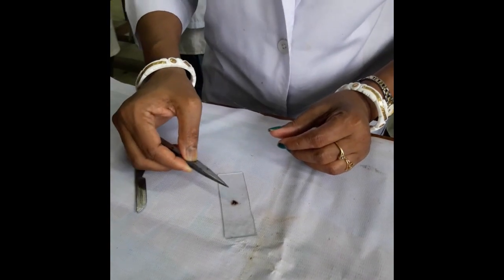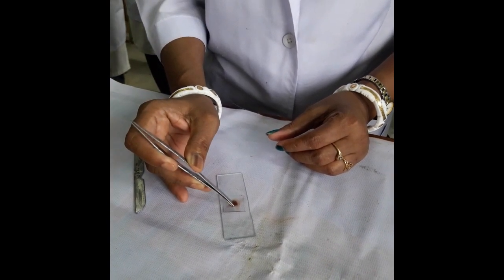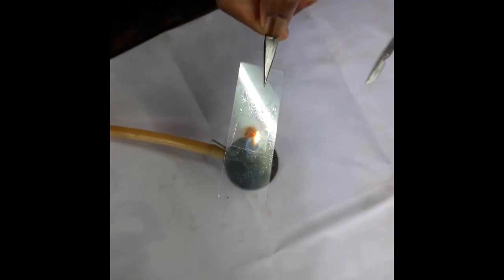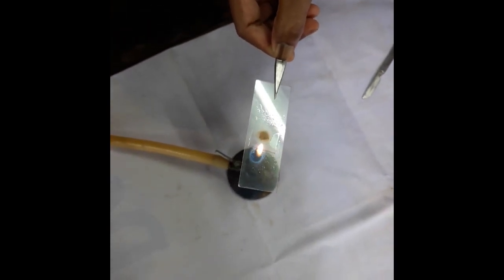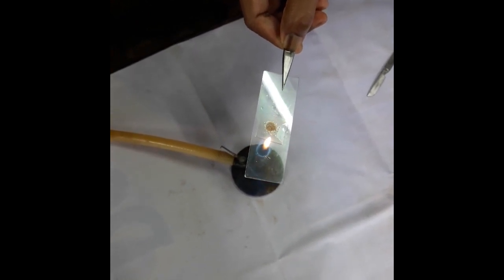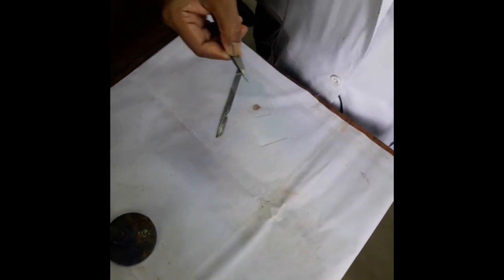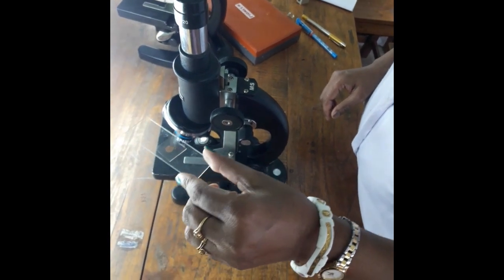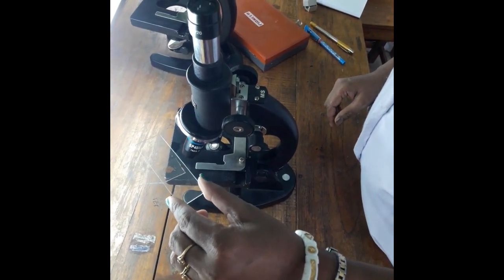Place the coverslip carefully. Now proceed with the observation of the Hemin crystal.